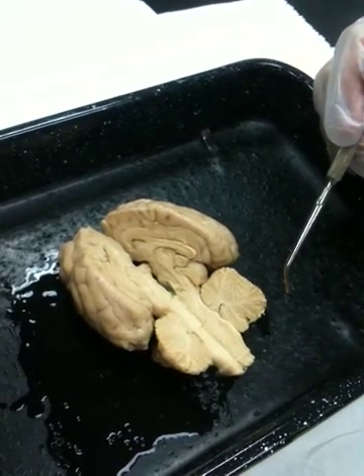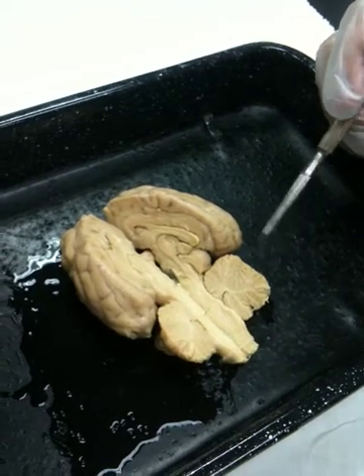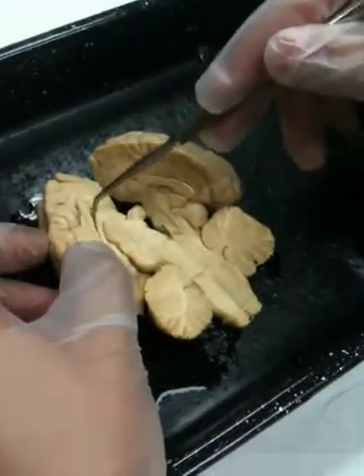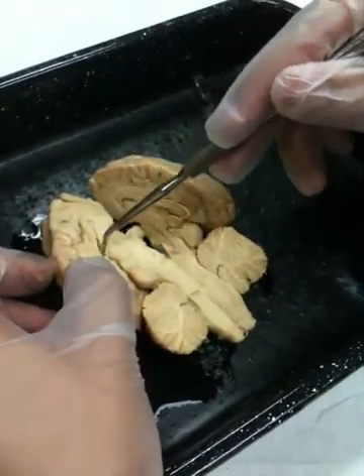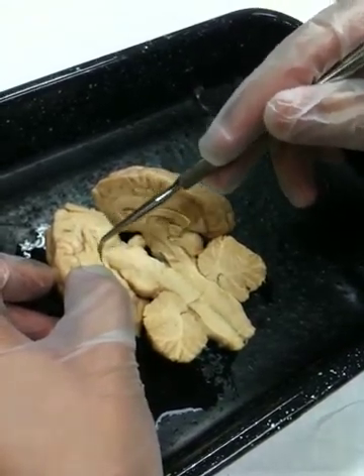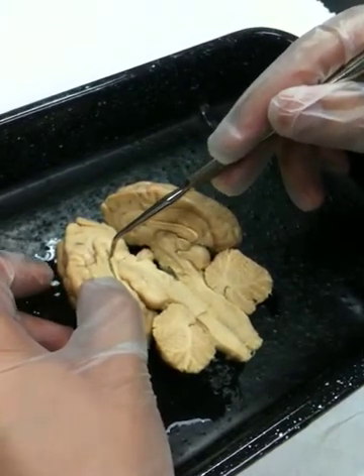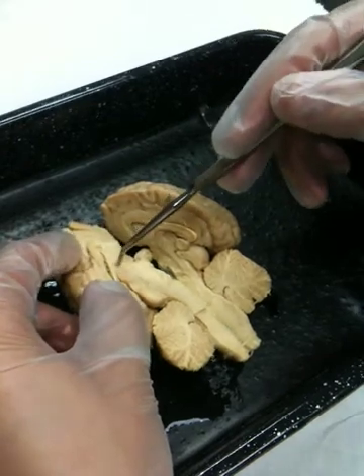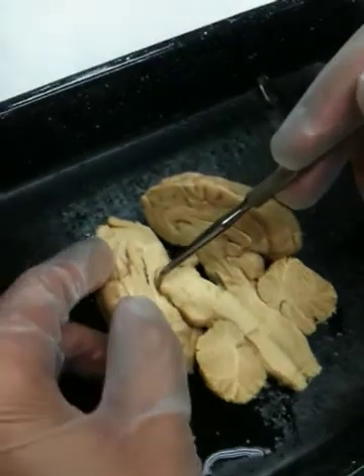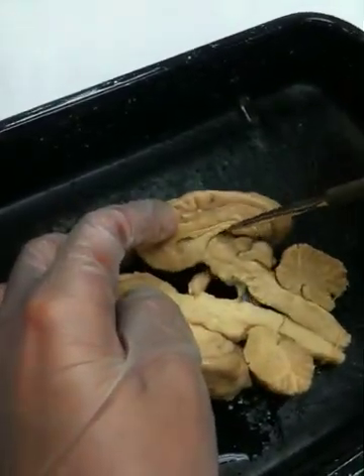There are cavities in the cerebrum, in the brain. One of the cavities would be right here in this half. As I open up this opening, this is called the lateral ventricle. There are two lateral ventricles, so there's one in this hemisphere of the cerebrum. There's also one in the other hemisphere. The third ventricle would be a region below this, which if I pull this apart a little bit, we can see some of this brownish material is actually within that other ventricle. So there's another cavity or space right there where the probe is running. We've actually sectioned through the third ventricle, right through the center of it.